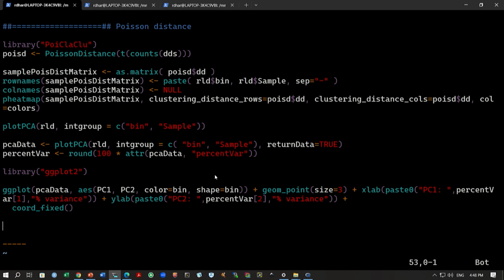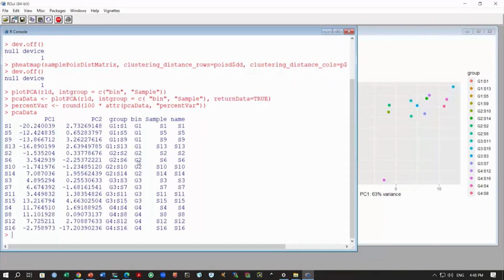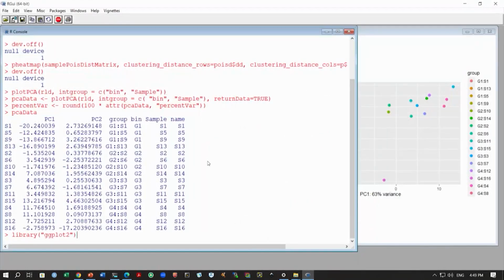So, in our PCA data, when you do PCA analysis, you might have 10 PCs, 100 PCs, and for each of them you will have the percentage variance calculated or explained by that PC. So, we can simply store this, we are just converting this to a percentage from this PCA data analysis. If you look at this PCA data component, again you will have these different components, PC1, PC2, group, bin, etc., and from this PCA data we are taking this attribute percent variance. So, this is the percentage of variance that is explained by each PC, and we are storing it inside this variable.